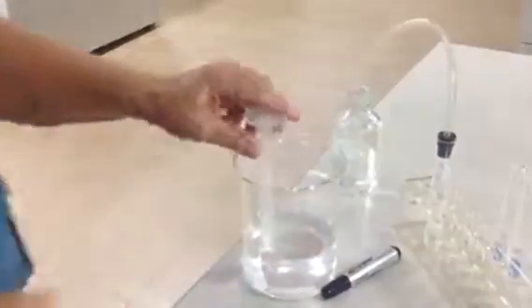Okay. This is hard to do, so you may not want to do this. It's up to you. This is one way of doing it. He's going to put that in there upside down like that. See how that does not get any air inside the tube? And then instead of just letting this bubble, he's going to put the tube down here. This is the hard part. And he has to get the tube to go up into the other tube.